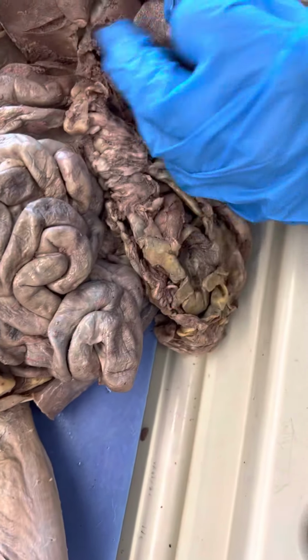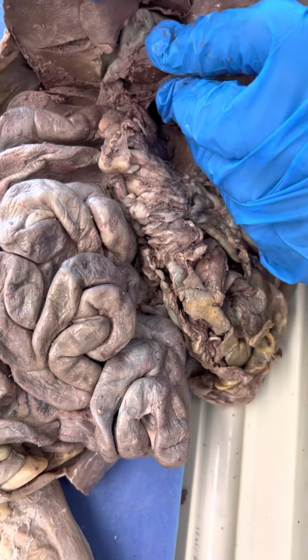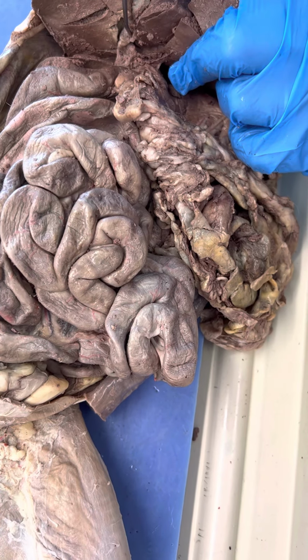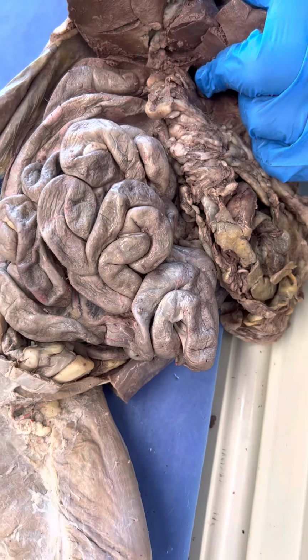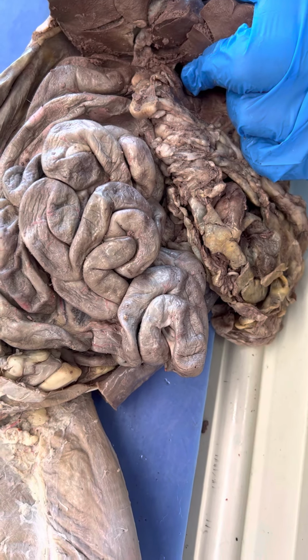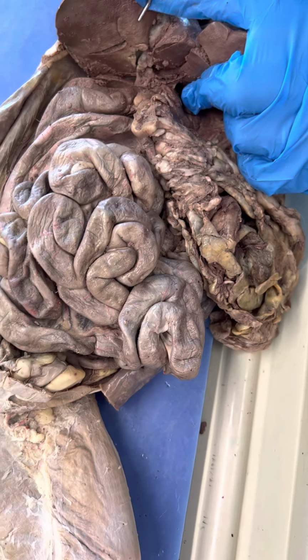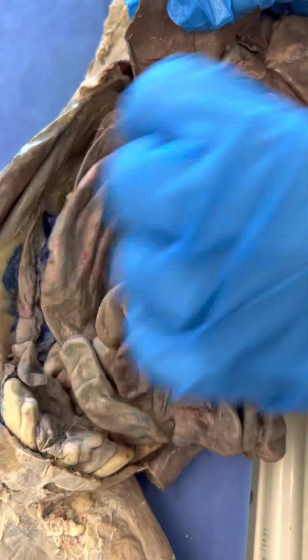Gallbladder, you should be able to identify the gallbladder. Cystic duct, if you've done this, comes off the gallbladder. Again, I would ask the cystic duct on the cat. I think the others would be hard on the cat. I would go to the model. But I think they have hepatic ducts, common bile duct. So you have two hepatic ducts, you have a cystic duct, one from each side of the liver. They join together to form the common bile duct. And then the common bile duct is going to go into the duodenum.